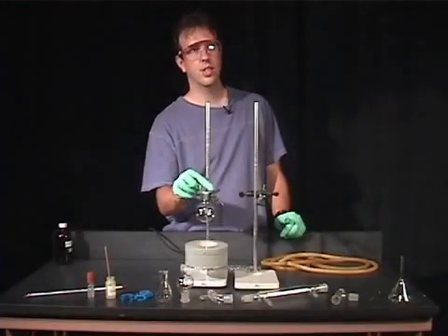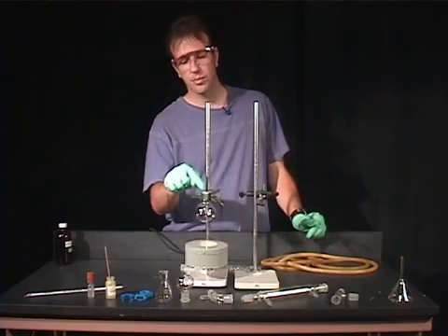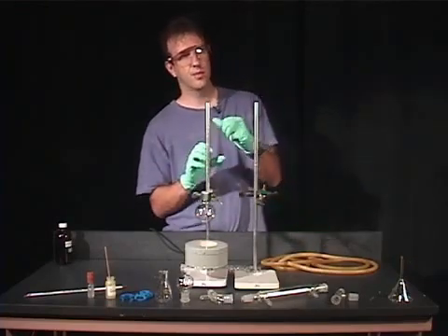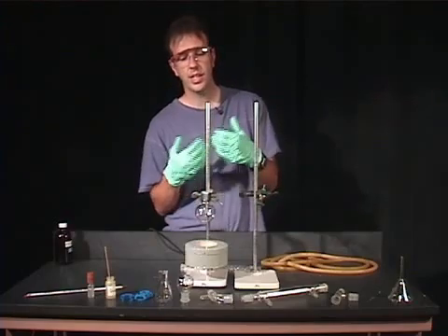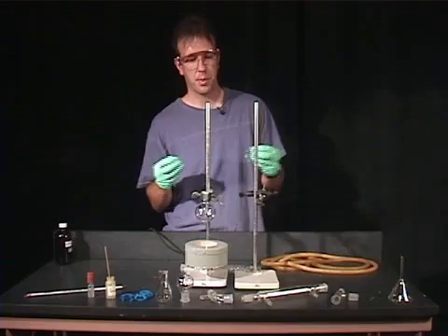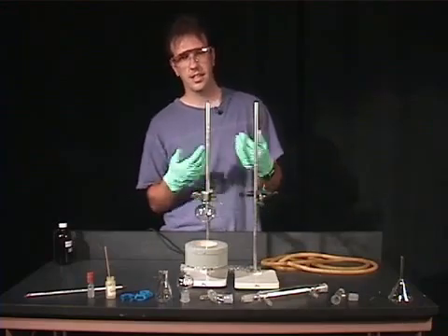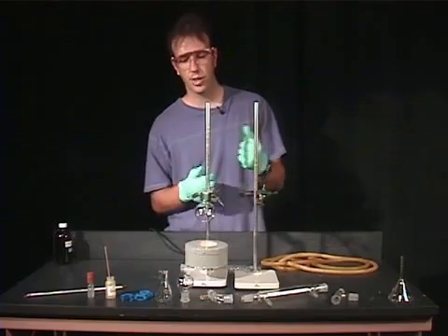We're going to grease these joints for two reasons. One is to prevent this glassware from freezing. When you heat glassware, it has a tendency to freeze, and it's very hard to take apart after the distillation. The addition of grease prevents that freezing, and you can take the glassware apart more easily.